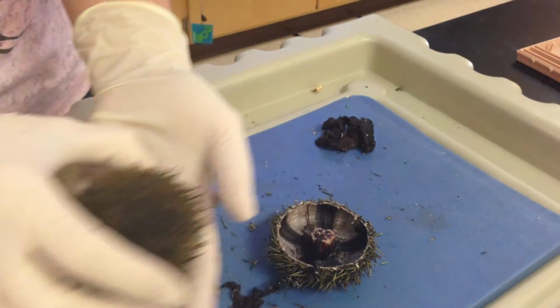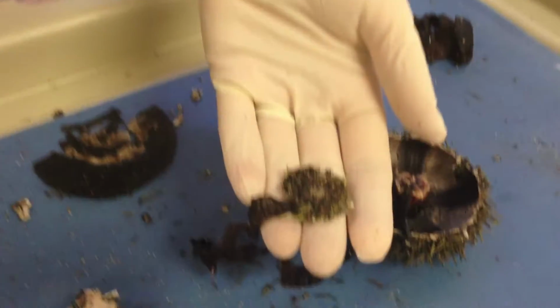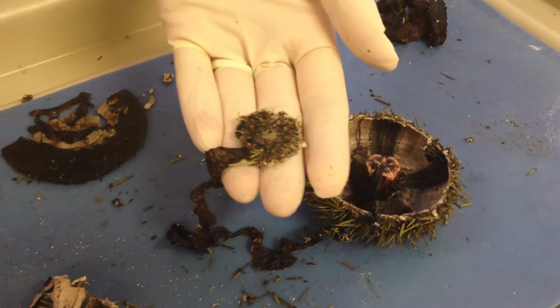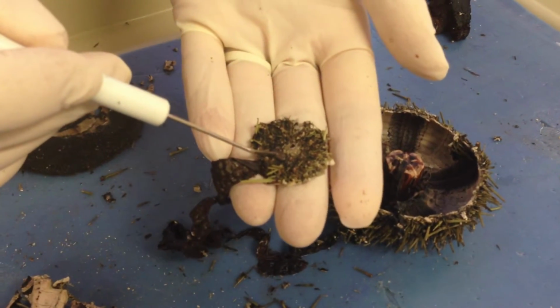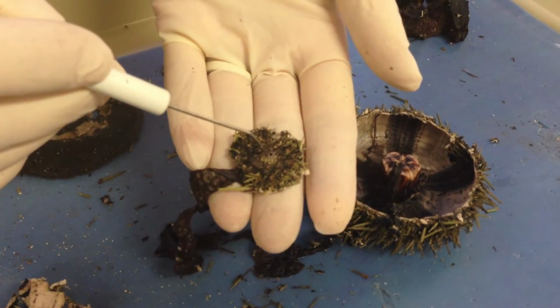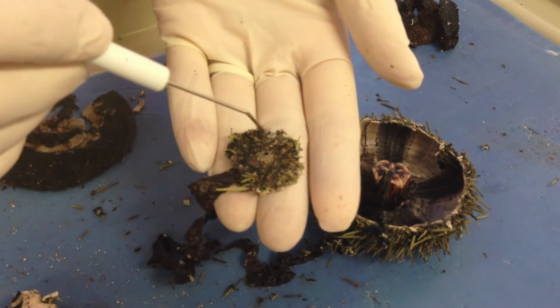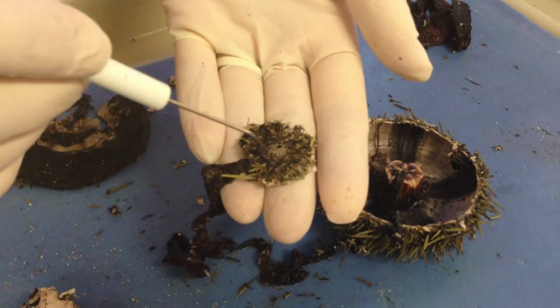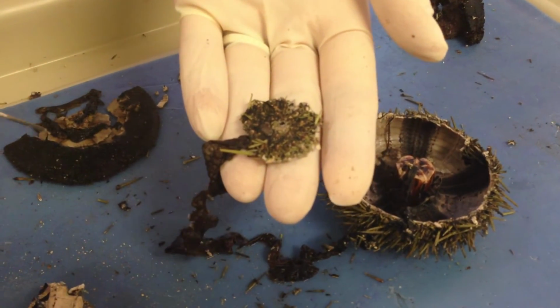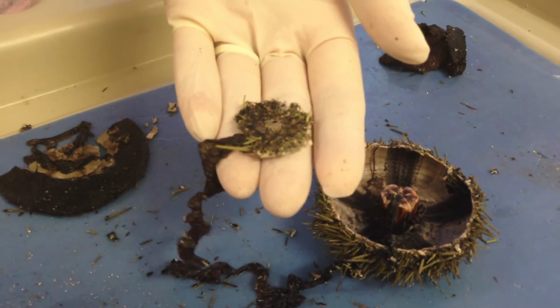So I'm going to move this over to the side, and if you observe here, you can see that this darker large region is the madreporite. And then the center region is the anus, and this region right here is the periproct, and these would be the genital plates. On each genital plate you're going to find a gonopore, which is a hole out of which the gametes will be released when it's time to spawn.